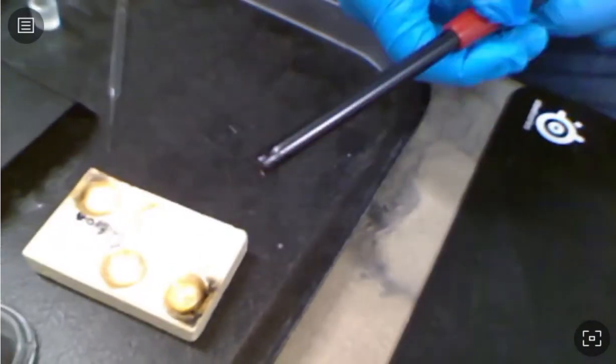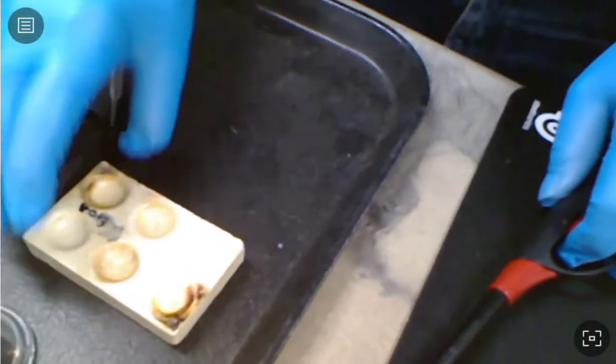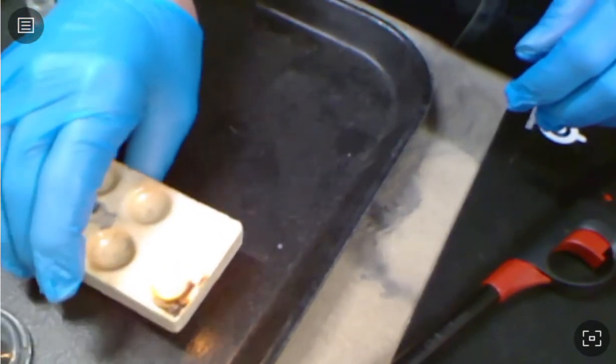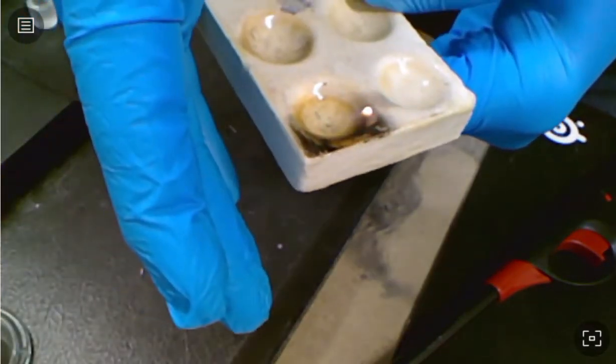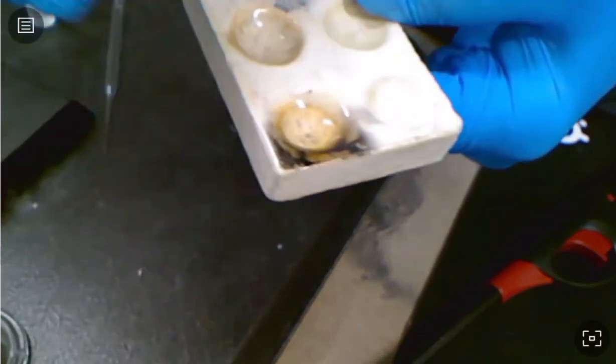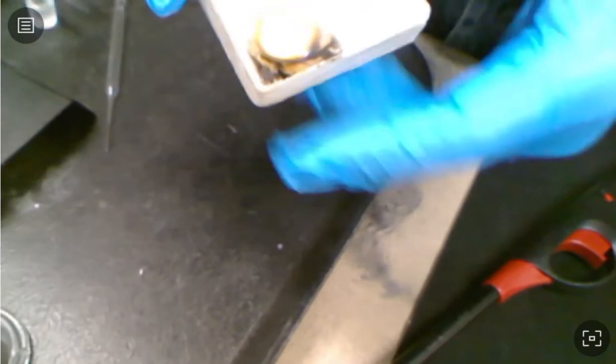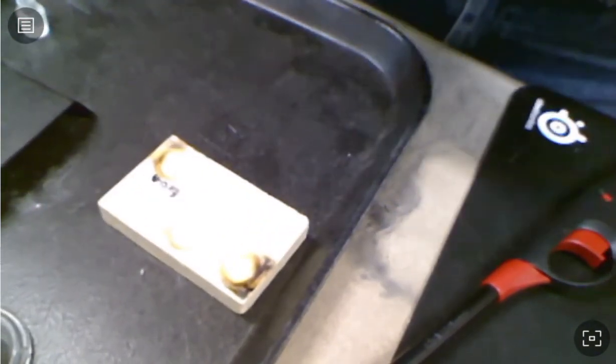And if I ignite that flame, and it will ignite, but it's kind of hard to see. See if I can shield it enough. Unfortunately, my camera doesn't pick it up, but that was a nice yellow flame. And she's all gone. When you do the lab, you'll be able to see it better.